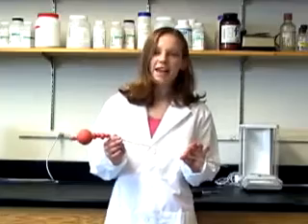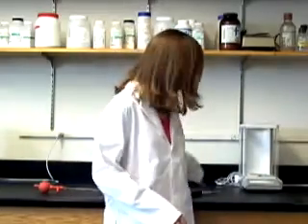Many laboratory procedures, especially biological and biochemical ones, require the precise transfer of small quantities of liquids. Glass pipettes, which are commonly used in chemistry labs, are simply not accurate when working with volumes that are less than 1 milliliter. The best method of transferring small volumes of liquids involves the use of an automatic pipette.